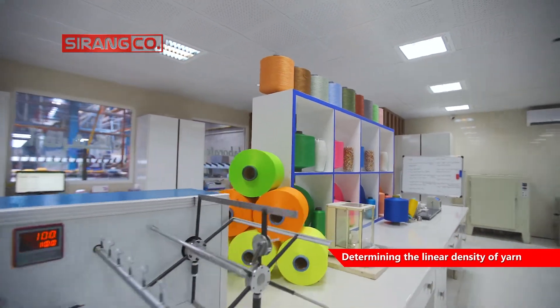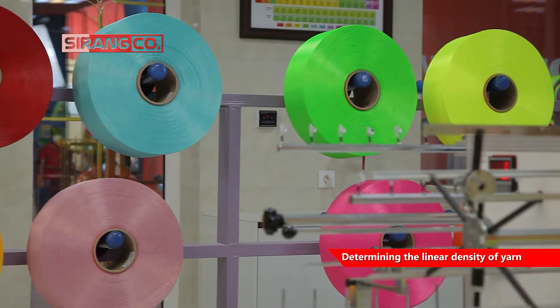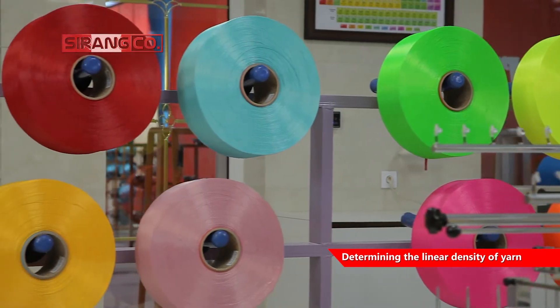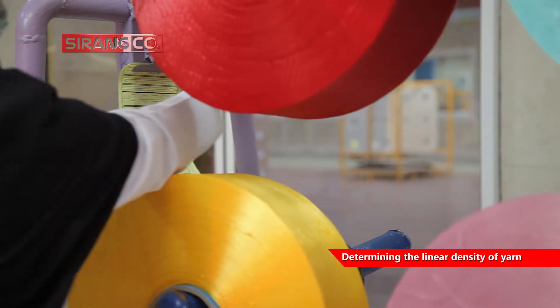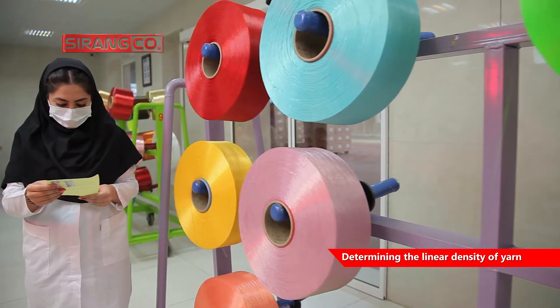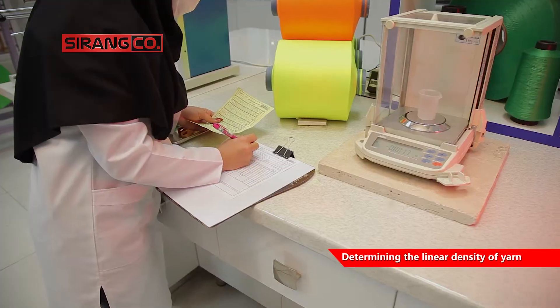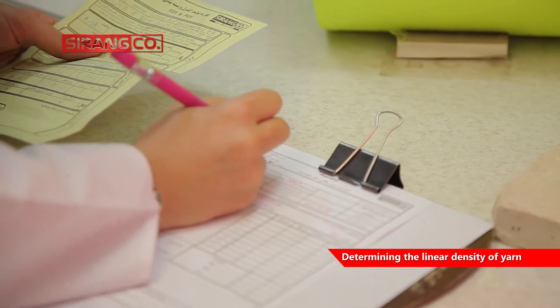Determining the Linear Density of Yarn. After the material and type of yarn, another characteristic that actually expresses its delicacy — in other words, determines the thickness of yarn — is linear density.